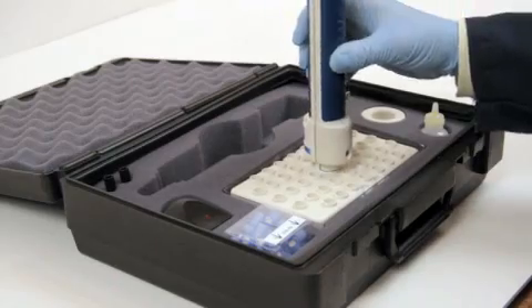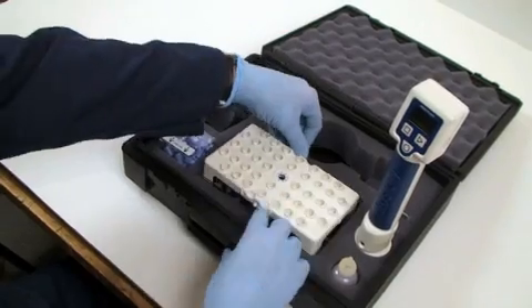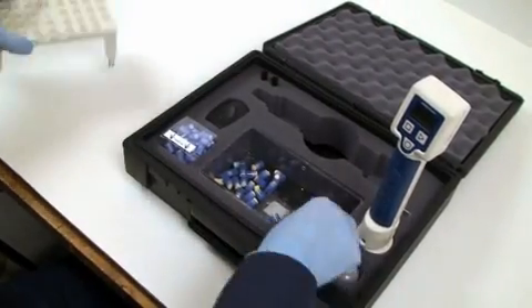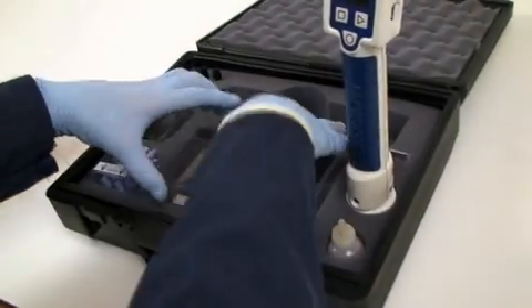Non-passive metal. Eject the last nib. We're out of nibs. Simply eject the top, and then you can easily dispose of all the old nibs. Then, put your container back.